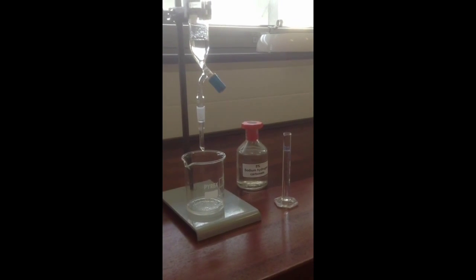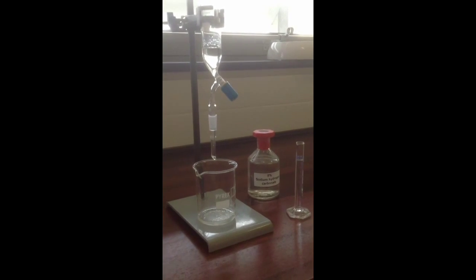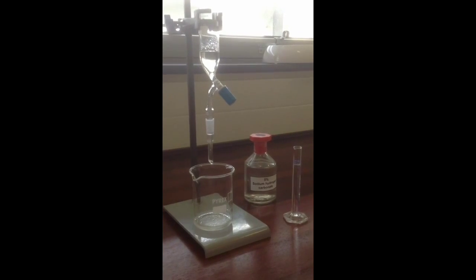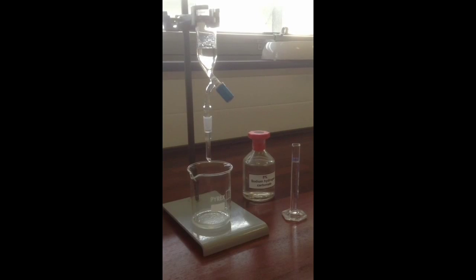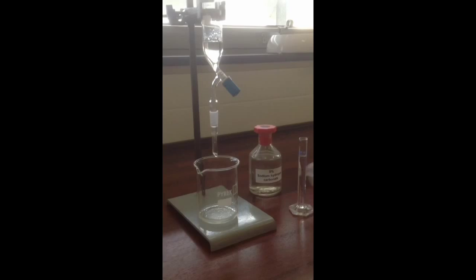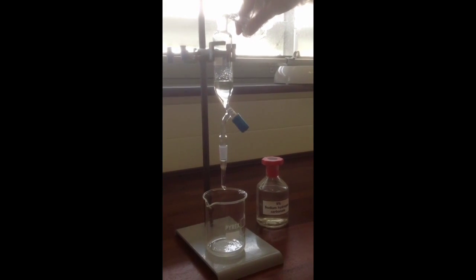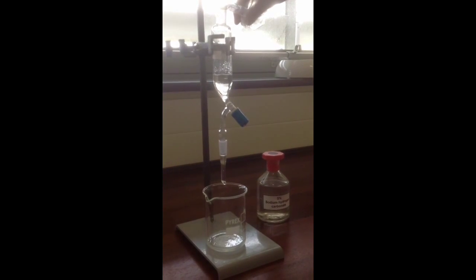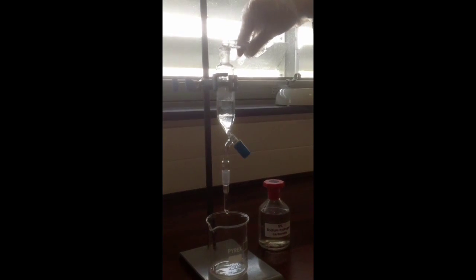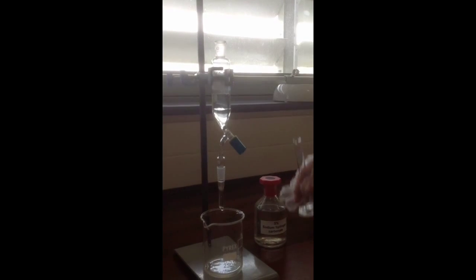So the first thing we're going to do is a washing step, and because we're going to be trying to remove acidic impurities in this step, the hydrochloric acid, we're going to wash with a solution of a weak alkali, in this case 5% sodium hydrogen carbonate solution. That'll neutralize the acid and help it dissolve into the aqueous layer that we're adding. So we're adding about 10 centimeters cubed, only approximately measured, in a measuring cylinder of the sodium hydrogen carbonate solution. The accuracy is not important at this stage.